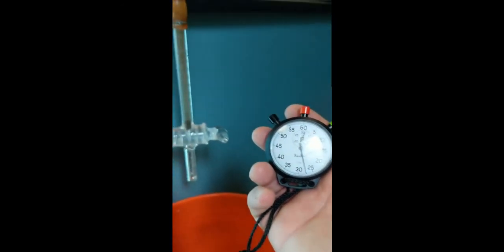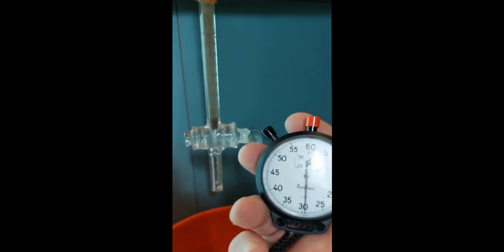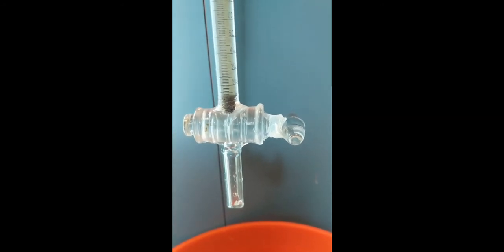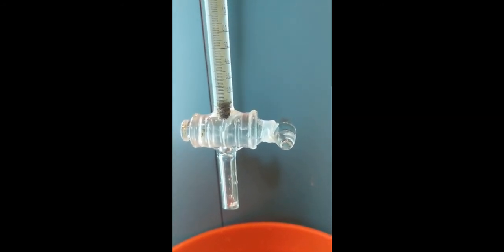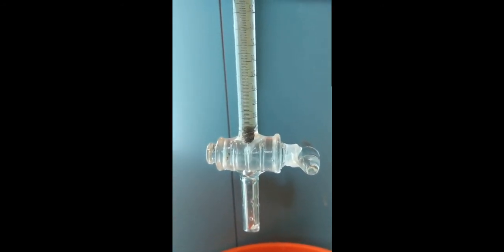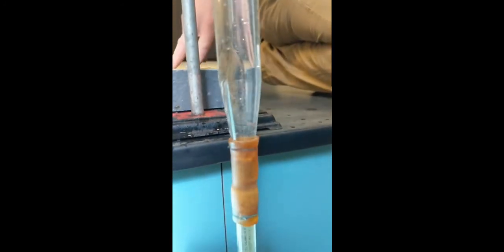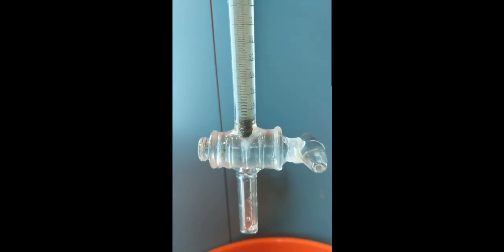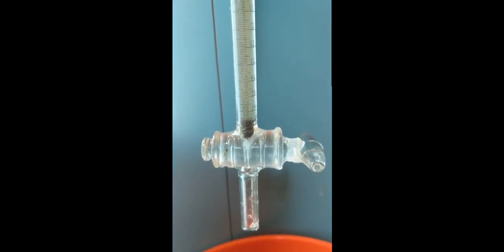So we're coming up on 90 seconds now for this muddy sample, and you can see we finally have something accumulated in the bottom of this settling tube, but hardly anything compared to what we saw before for the sandy sample. So remember, we have all these very fine particles of silt and clay and mud that are very slowly settling down through our water column, really illustrating the difference between the sediment at this muddy place versus the sandy sample from before.